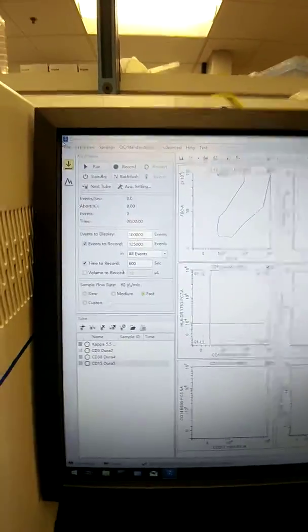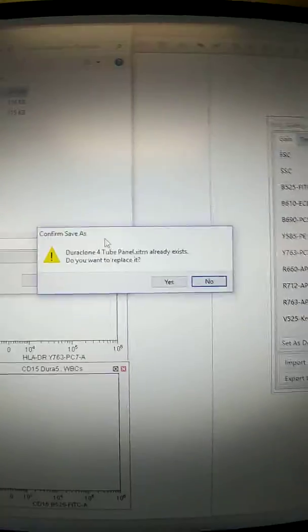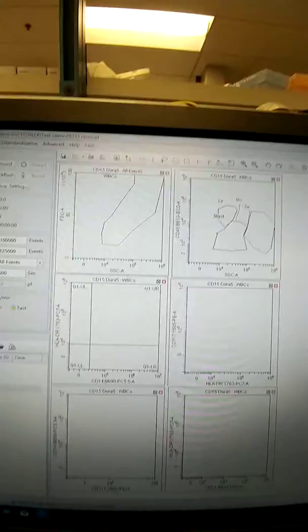So what I'm also going to do real quick, so I don't have to remember to change that every time, is I'm going to go back and do File, Save as Template, and then I can find that original one and click on it and save. Okay, it's telling me it already exists. Do I want to replace it? I'm going to click Yes. So now it should save the template with these acquisition gains. I typically check every time I run one anyway to be sure.